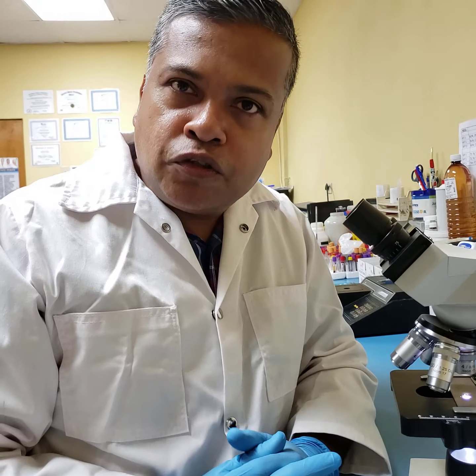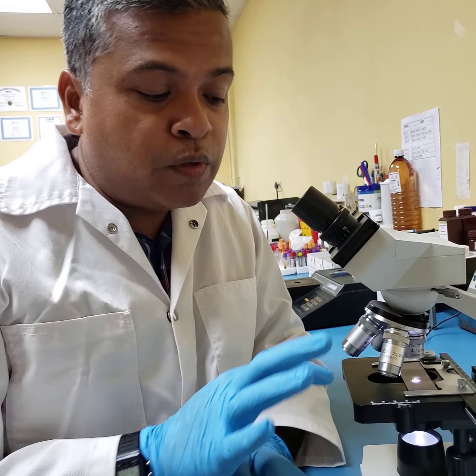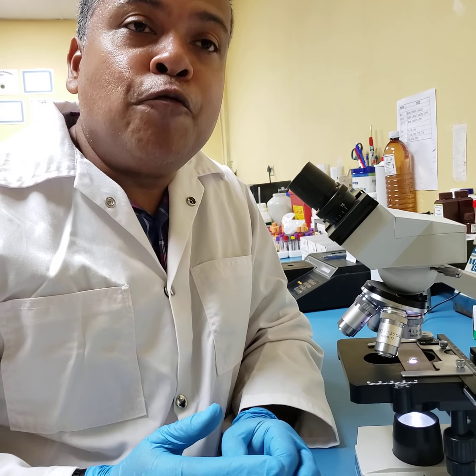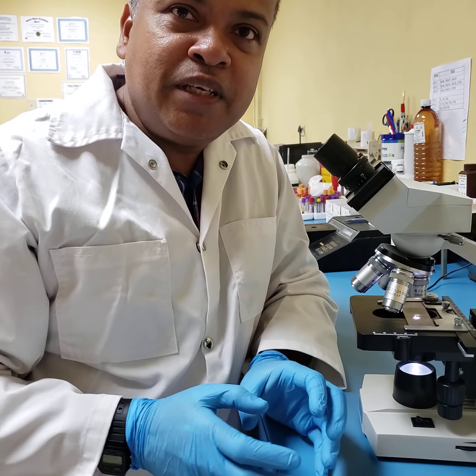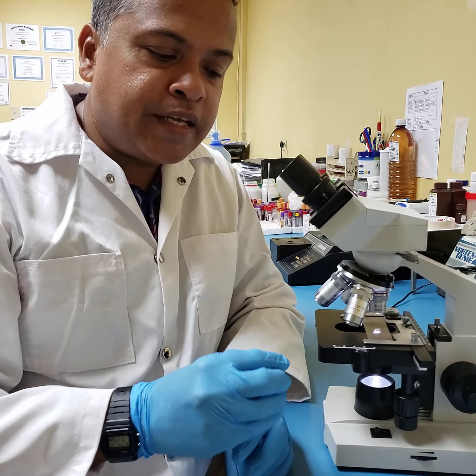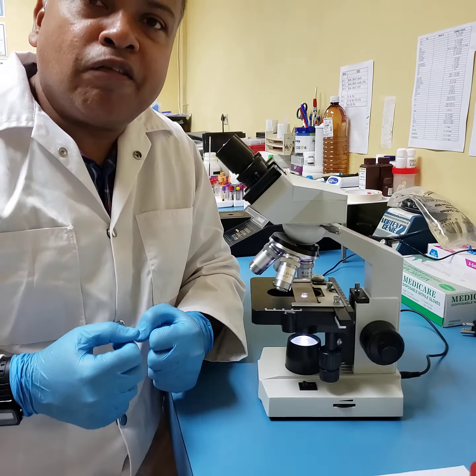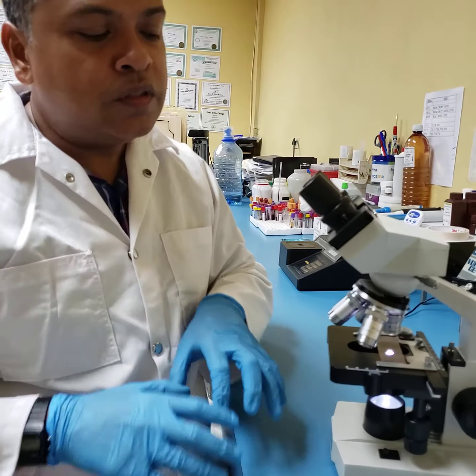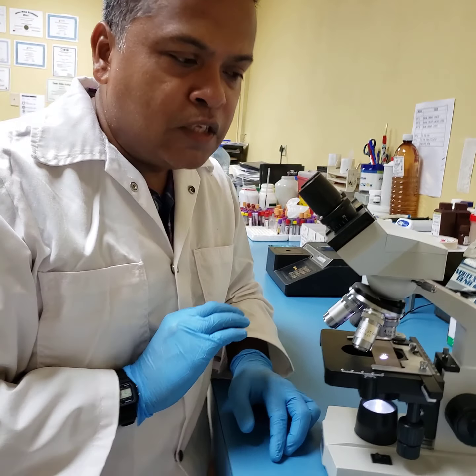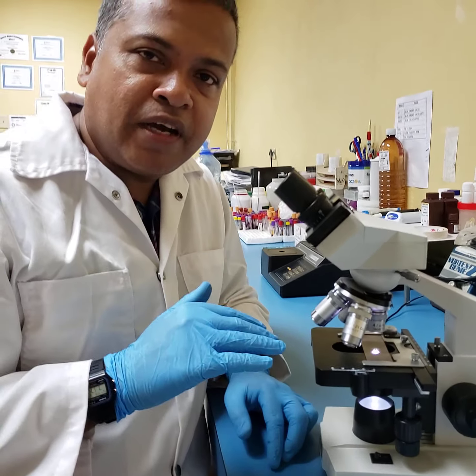Now, at this point, I want to introduce you to something called parfocal, P-A-R-F-O-C-A-L. What that means in microscopy is that it is a term used to describe a microscope's ability to maintain its focusing capabilities even when lenses are changed from one lens to the next. A good working microscope will have a good ability to maintain strong parfocal capacities. All right, so because this microscope is parfocal, I have located an image with my 4 objective. So now, 10 by 4, the image has been magnified 40 times.